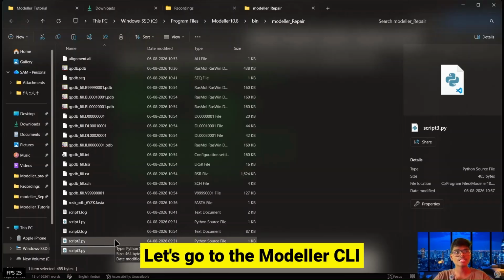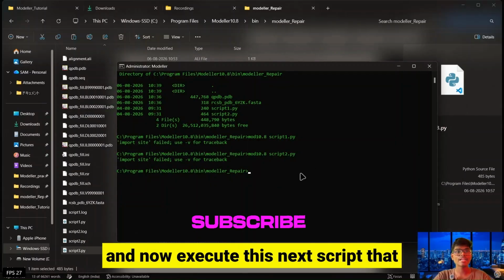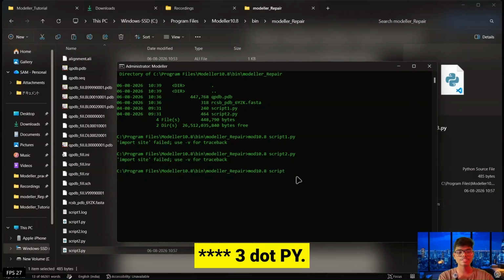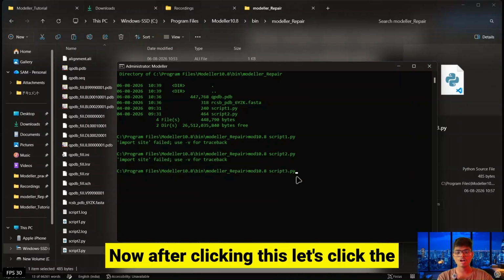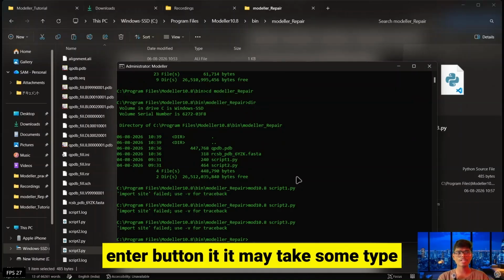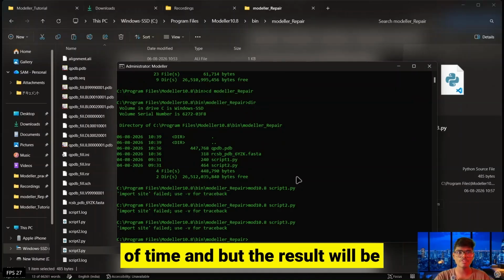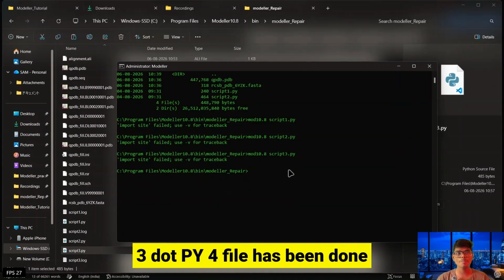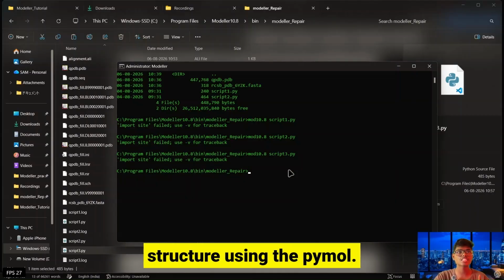Let's go to the modeller CLI and now execute this next script, that is mod10.8 script3.py. Now after typing this, let's click the enter button. It may take some time, but the result will be more and more precise. So the script3.py file has been run successfully. Let's visualize the structure using PyMol.